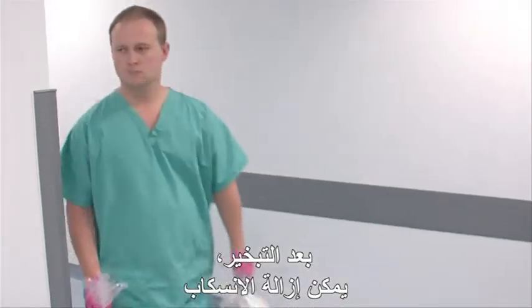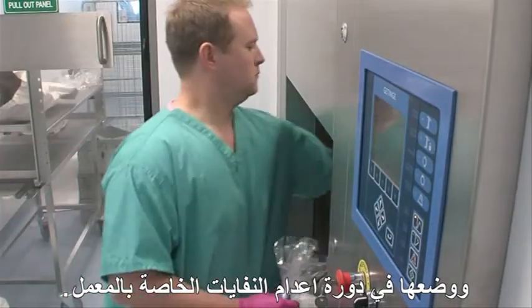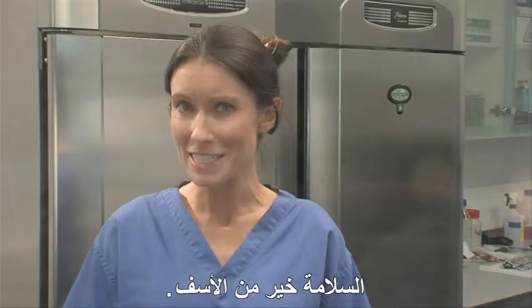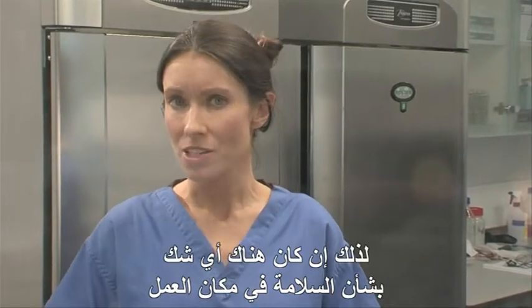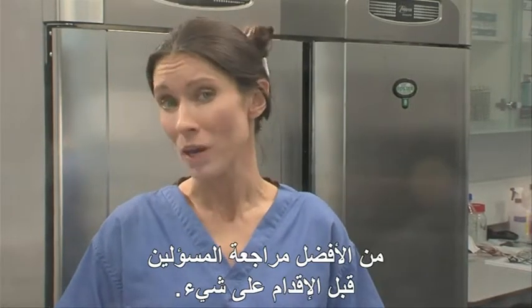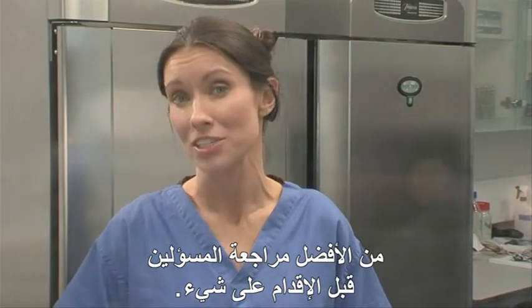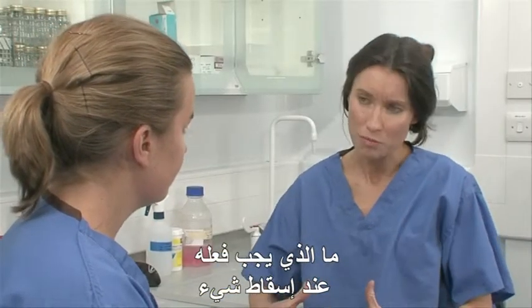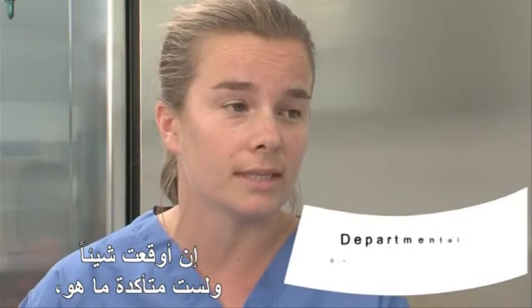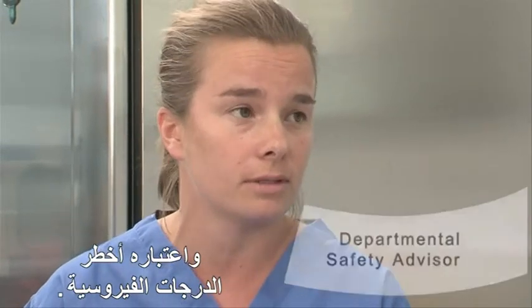After fumigation, the spill can be cleared up and, along with the discarded waste, put through the lab autoclave waste cycle. It's always better to be safe than sorry. So if there is ever any doubt about safety in the workplace, it's always worth seeking the advice of those in the know prior to action. What should you do if you drop something and you don't know what it is? If you spill something and you're not sure what it is, then you need to act according to the protocol and assume it's the highest category of virus.